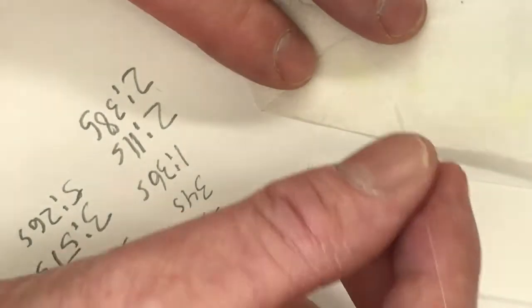All right, let me take my last one here. I've got some out of the reaction. Oh, that one didn't break very good. I want to break this one again and do it again. So draw out of my reaction.